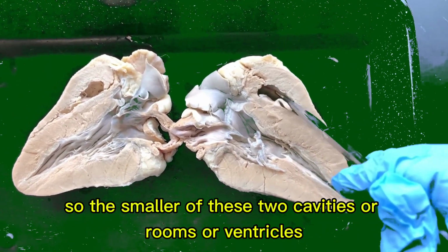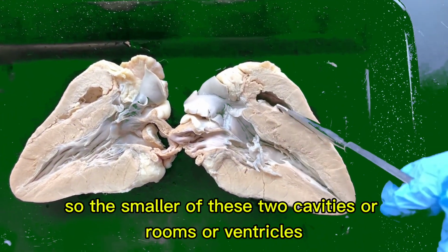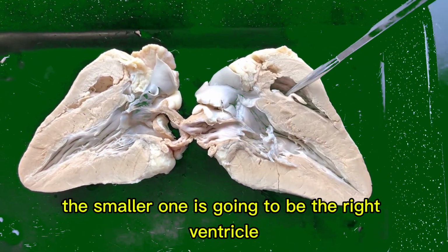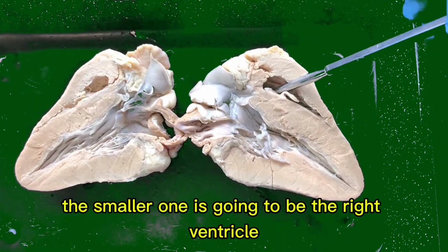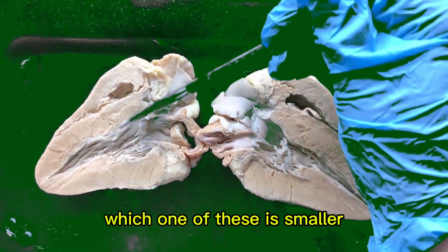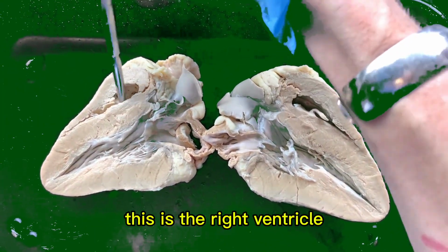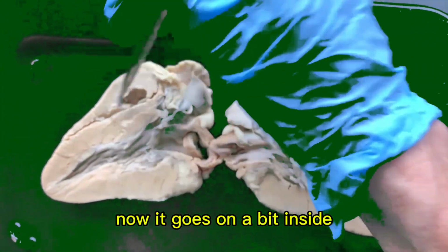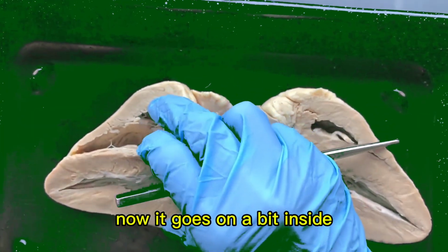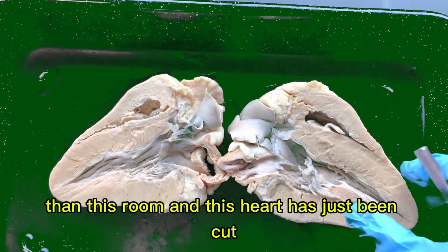So the smaller of these two cavities or rooms or ventricles, the smaller one is going to be the right ventricle. Now let's look on this side. Which one of these is smaller? If you said this one on top, you're right. This is the right ventricle. Now it goes on a bit inside. It's still smaller though than this room. And this heart has just been cut.